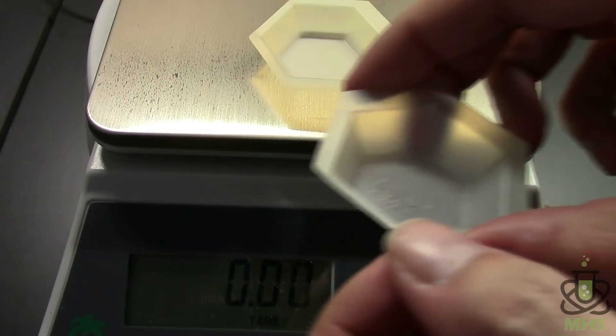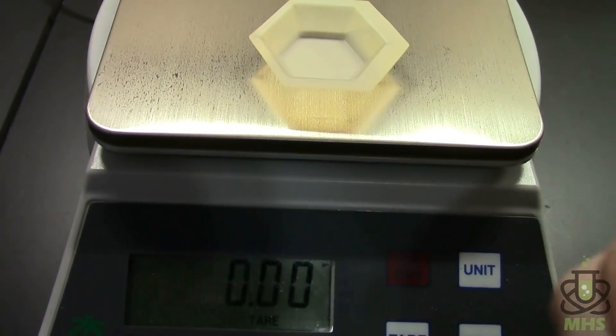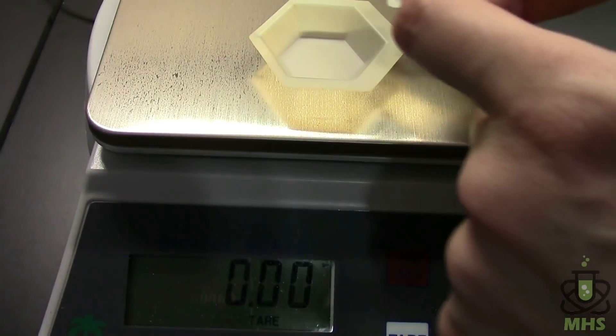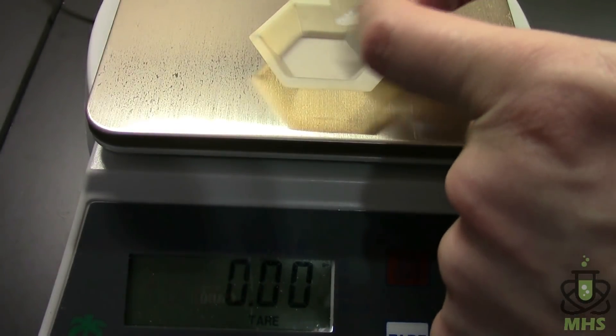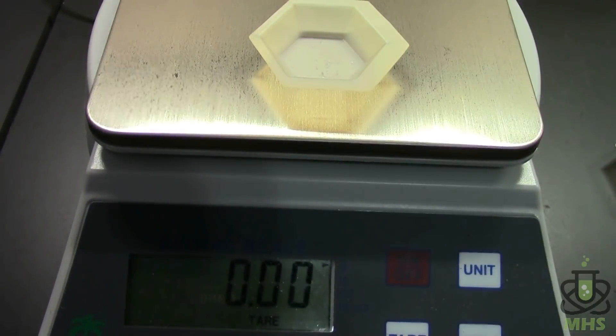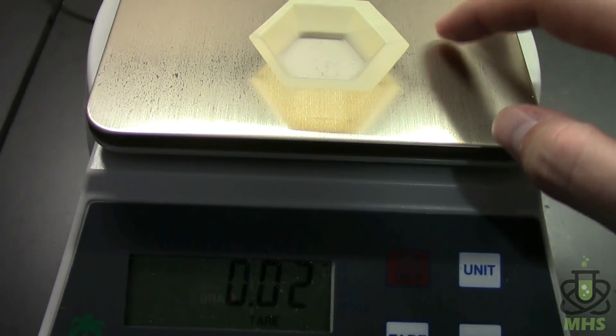Okay, so here they are after the reaction. Looks to me like they're much smaller, but let's see if that's true. Oh, it doesn't even register anymore. Let's see if I can get it.